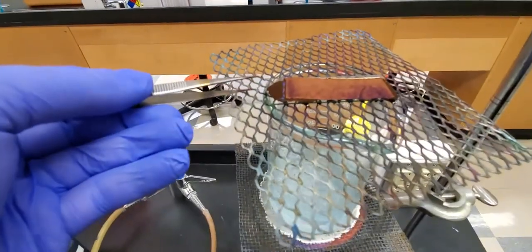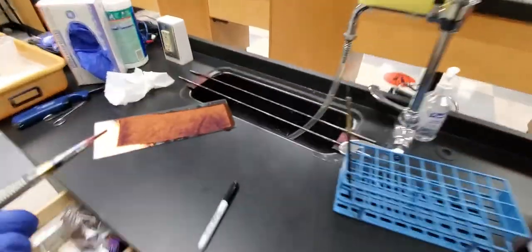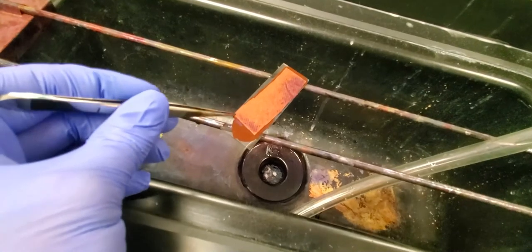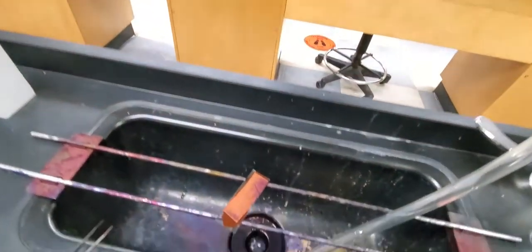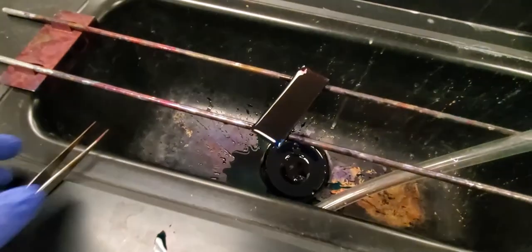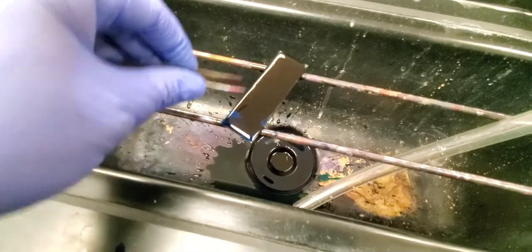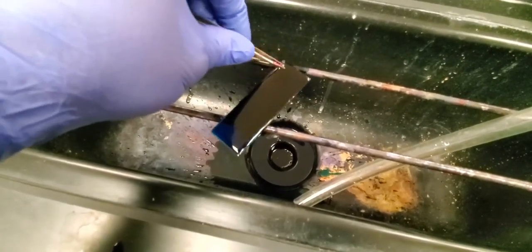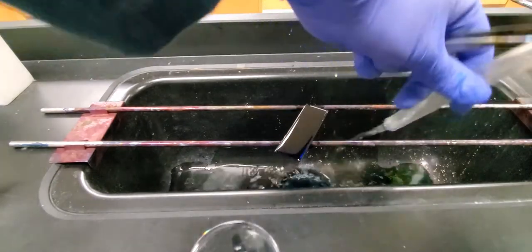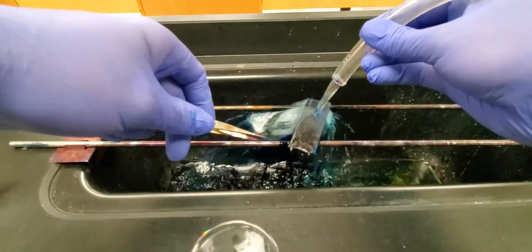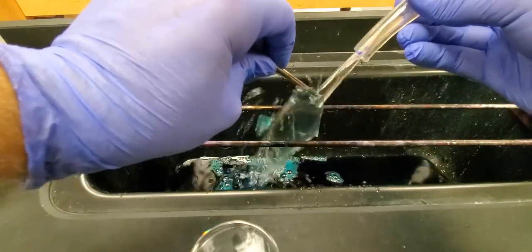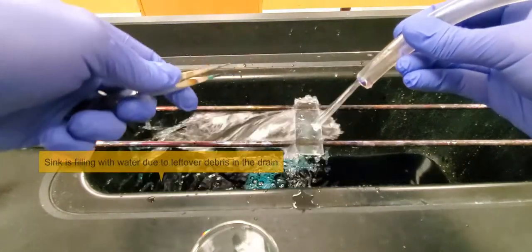We're going to take this endospore stain slide and move it over to my sink. It's still pretty hot but I will get some water to moisten this a little bit. We want to make sure that we get that dye off of there. You can see I'm wearing some gloves because this technique is notorious for getting green dye everywhere. Now I am going to the stream of water here and I am decolorizing this. We can just use water as our decolorizer which is really convenient for doing this process.